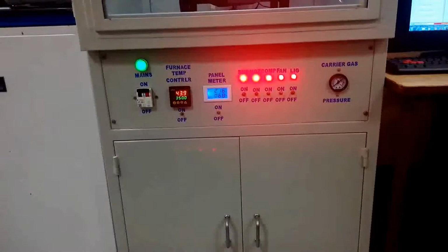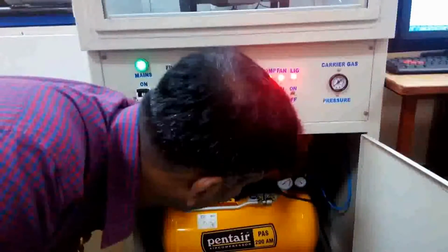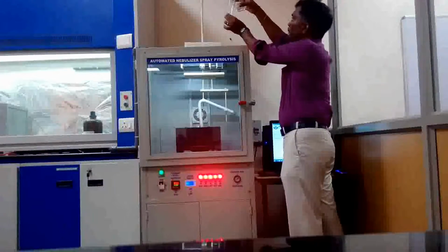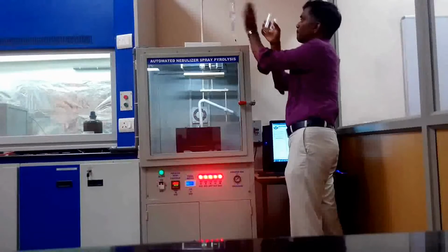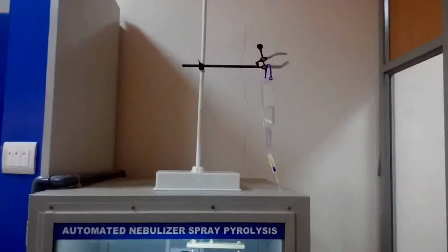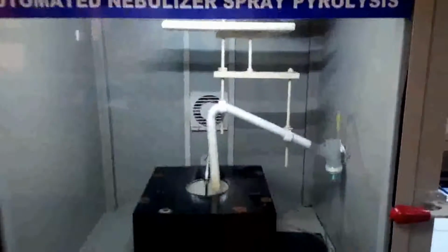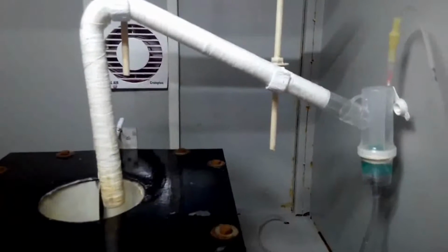In the meantime, the compressed airflow should be checked and the precursor feeding arrangement should be filled with the precursor solution. The solution should be allowed to flow to fill the nebulizer. The unit is ready to perform the deposition now. Once the substrate temperature is reached, the deposition will automatically start.